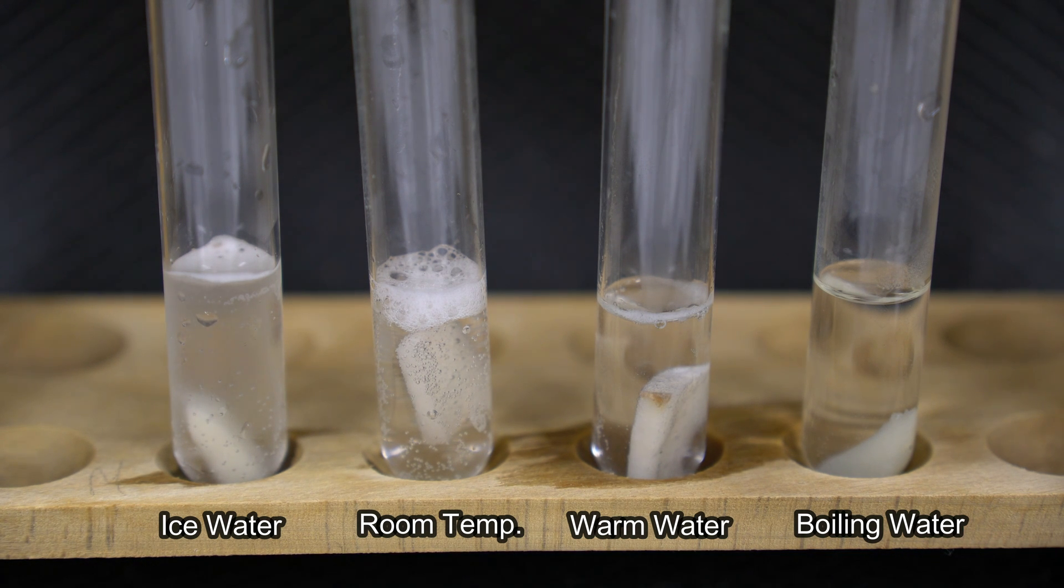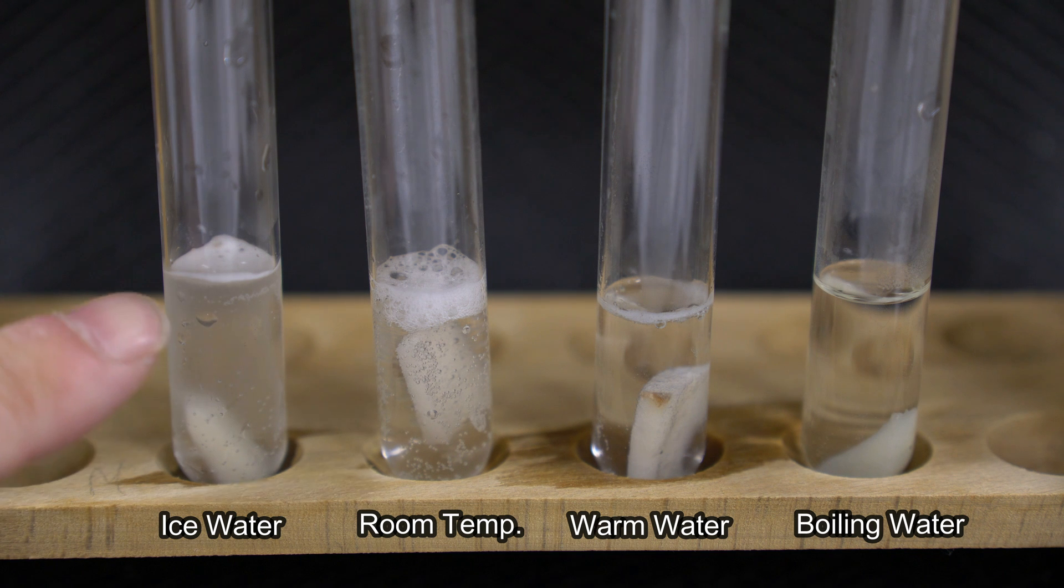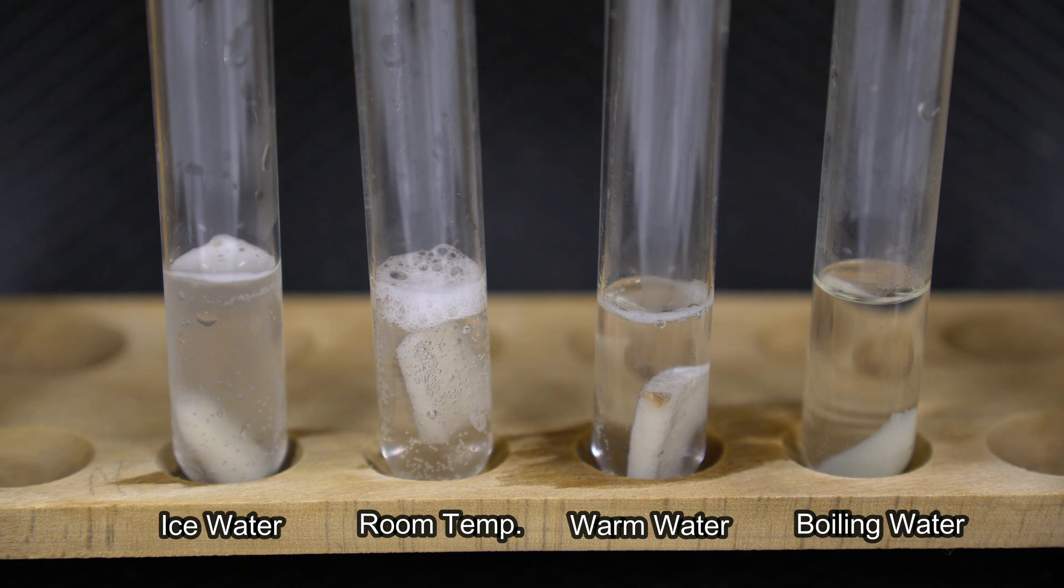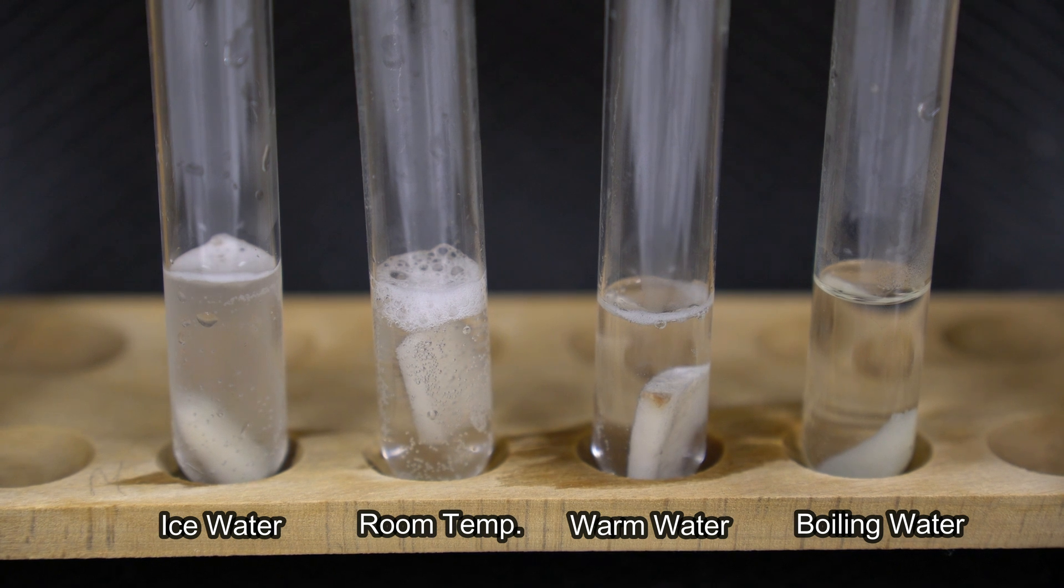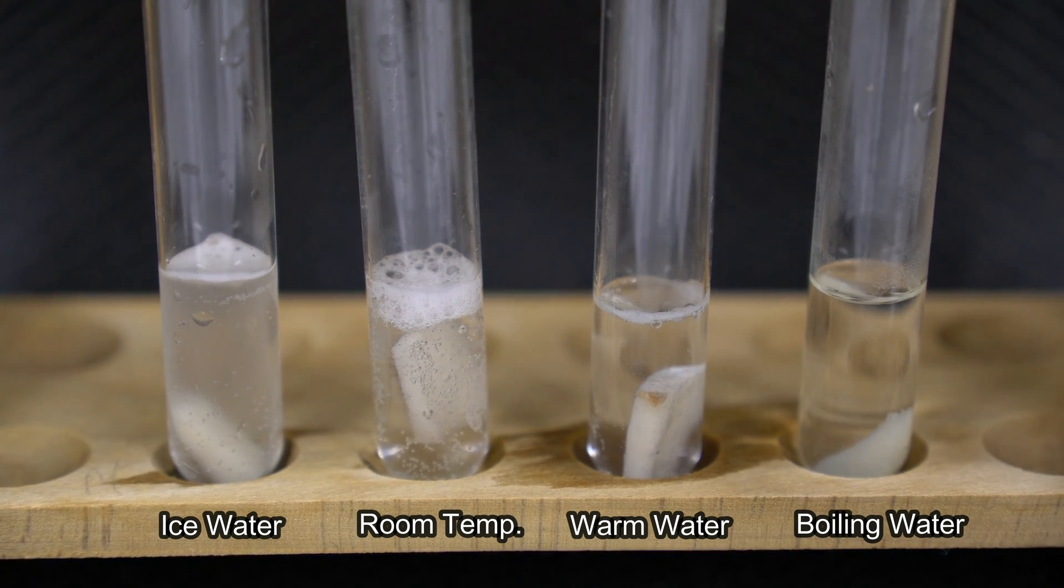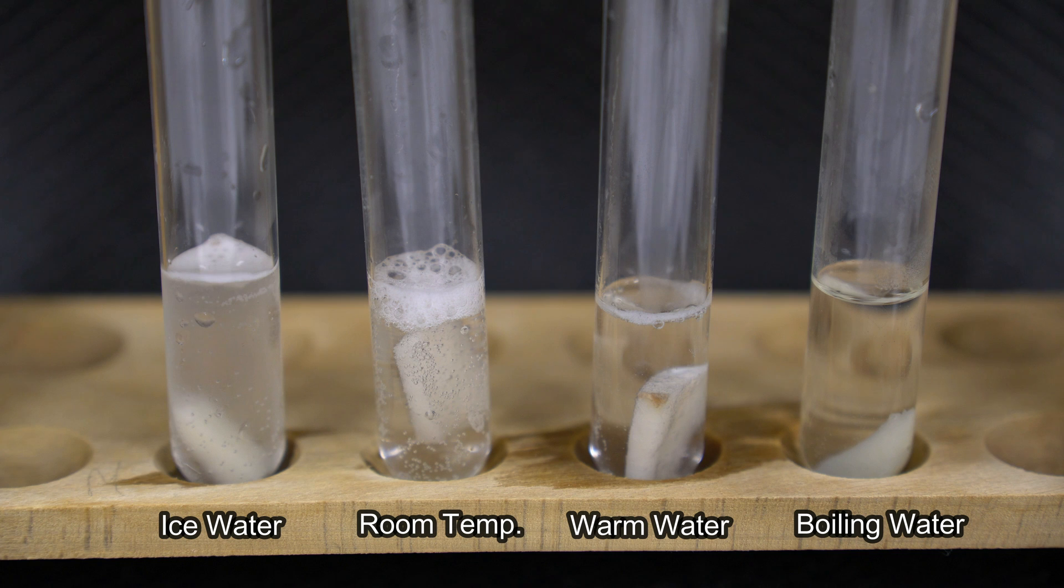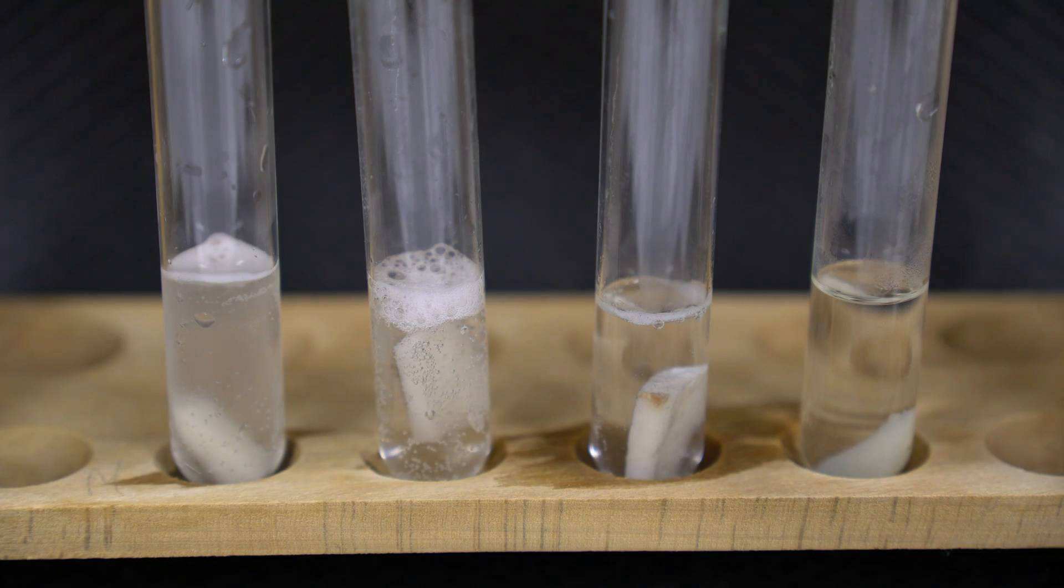Now you can see as it's warming up, we're noticing there is a little bit of a reaction occurring here. By far, the room temperature is performing the best with the greatest amount of bubbles produced. The warmed one does have a couple bubbles produced, but nothing really great. The boiling one is just stagnant. So what does this tell us about the optimum temperature for the catalase enzyme?